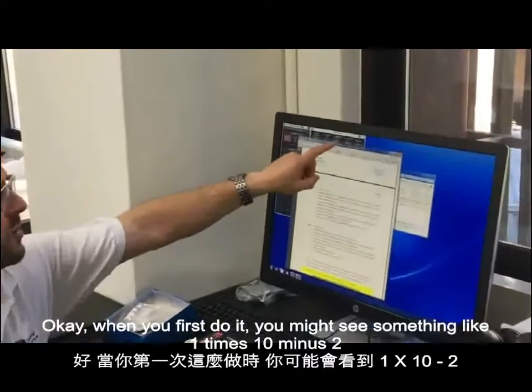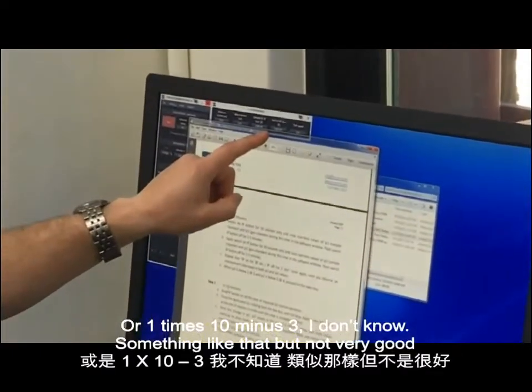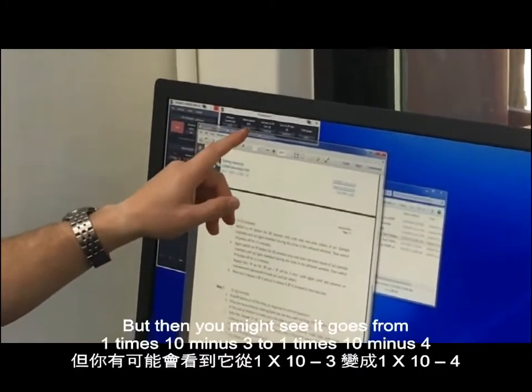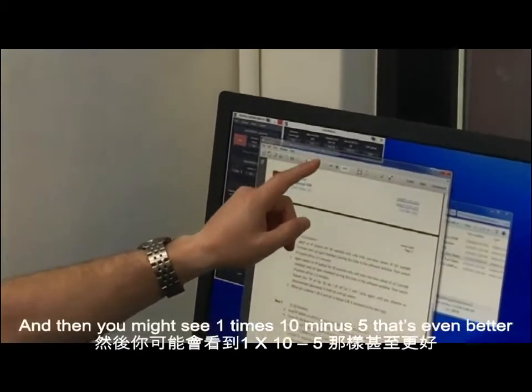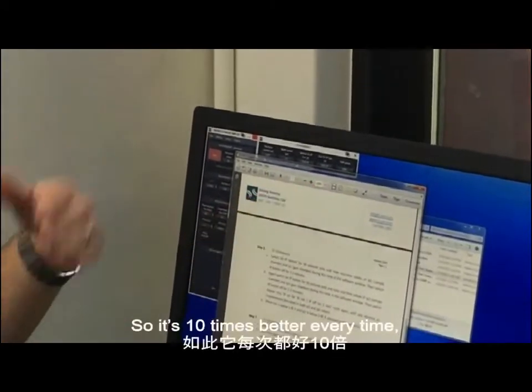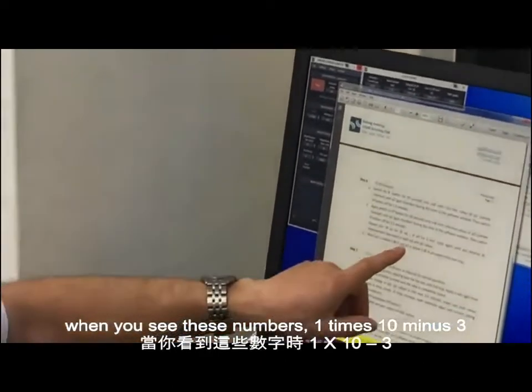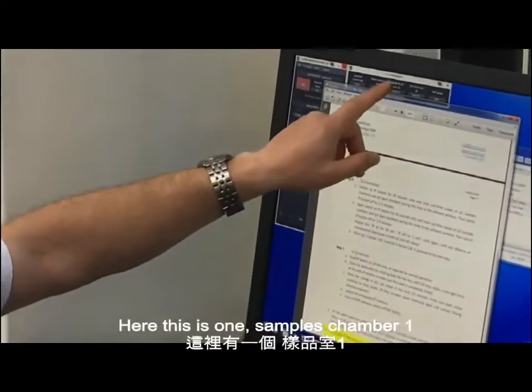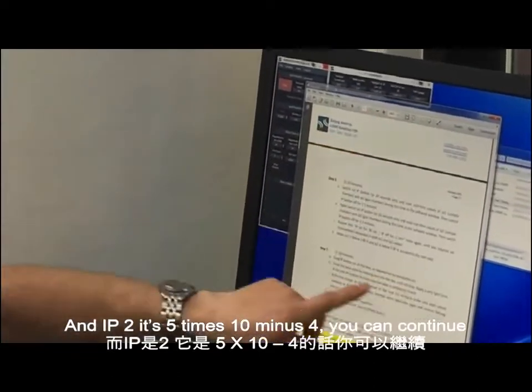When you first do it, you might see something like 1 times 10 minus 2, or 1 times 10 minus 3, I don't know, something like that, but not very good. But then you might see it goes from 1 times 10 minus 3 to 1 times 10 minus 4. It's getting better. And then you might see 1 times 10 minus 5. That's even better. So it's 10 times better every time. When you see these numbers, 1 times 10 minus 3 here, this is 1, sample chamber is 1, and IP2 is 5 times 10 minus 4, you can continue.